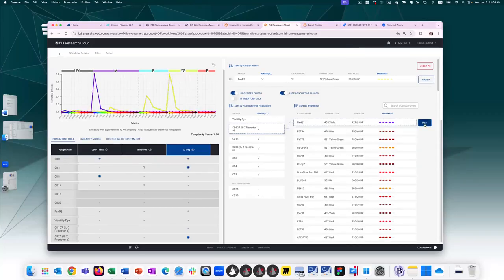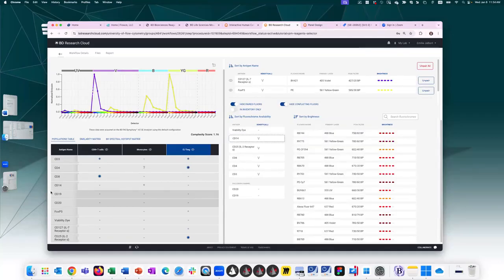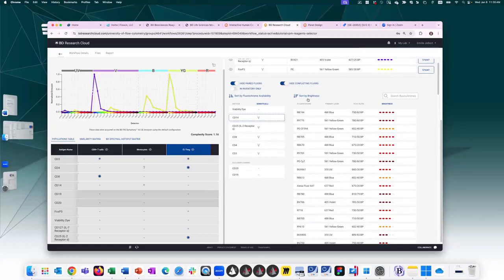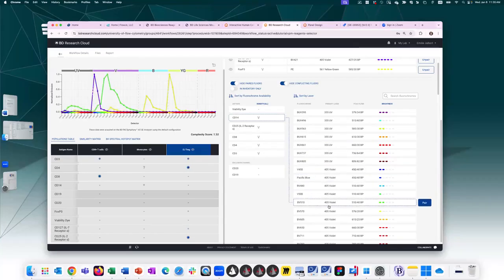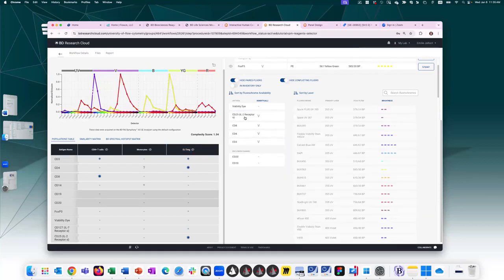Let's go ahead and just select BV421. So CD14 here, I didn't put any antigen density. It was a default value of positive. So maybe I want to assign it an intermediate value of brightness. I personally prefer to look at laser line to try and space these out and then find something bright within that. So maybe in the UV line, starting up top here, I look for something intermediate. You can look at the profile, see how it works best for your cytometer, and just click on them and make a decision. I don't want too much interference, so let's go ahead and there.